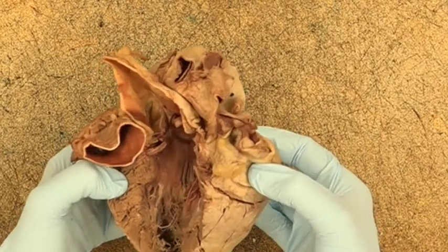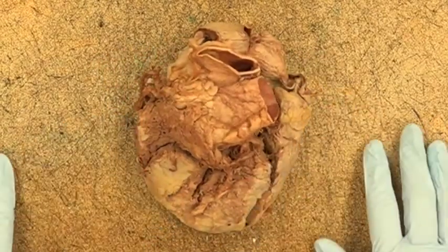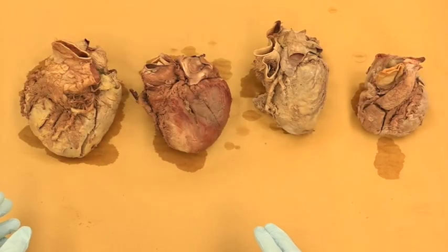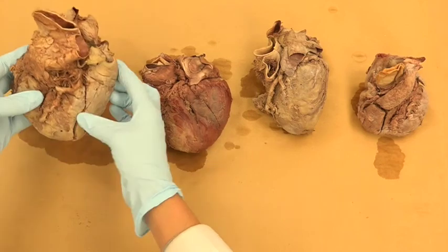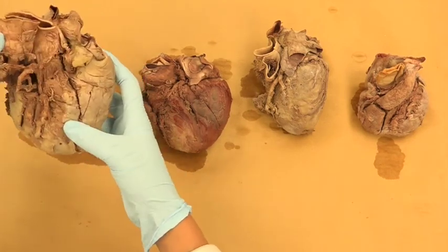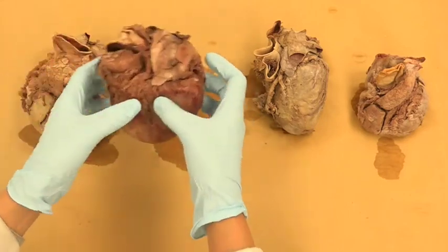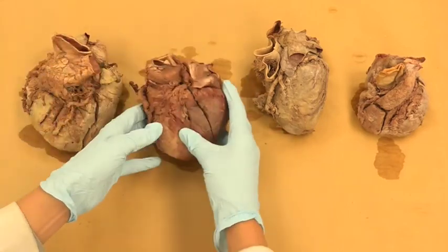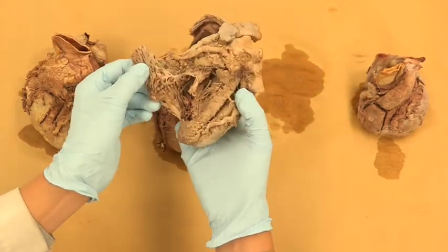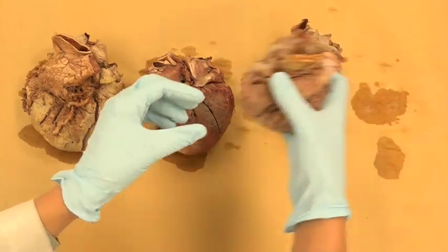The heart may have been cut during dissection activities to allow for the viewing of ventricles and atria. You can still proceed with the evaluation steps, but be sure to pay particular attention to the organ's orientation during sectioning. The first step involves weighing the heart to check for whether the organ is in a normal range. The laboratory guide has a chart for male and female normal ranges.